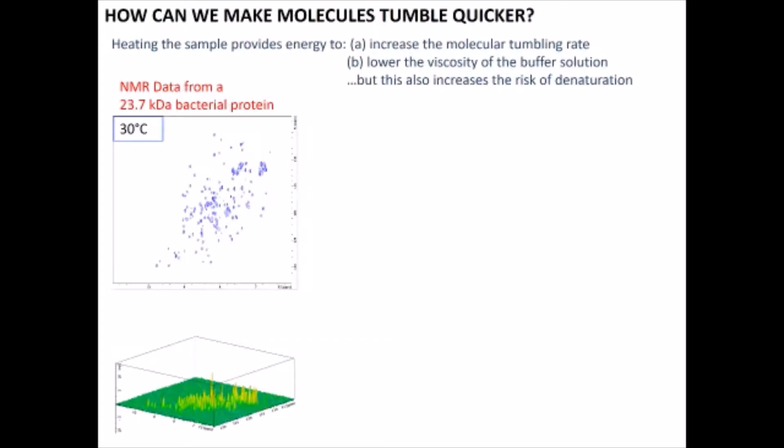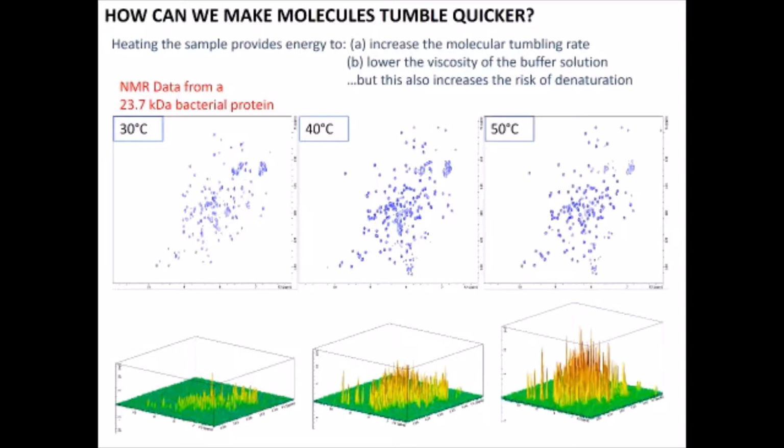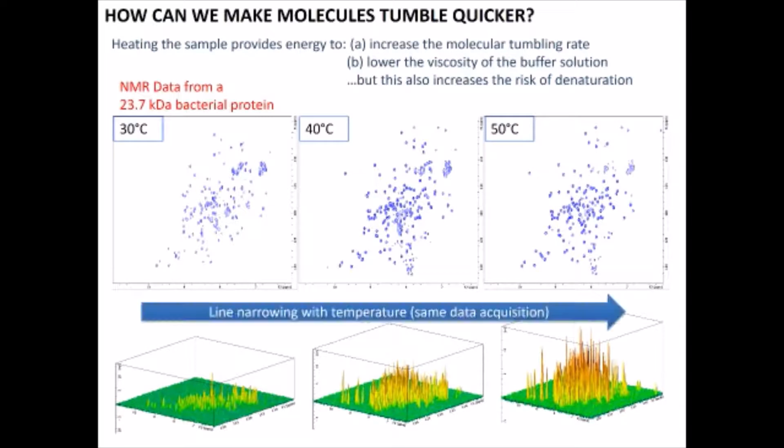So for example, this is NMR data from a bacterial protein at 30 degrees. At 40 degrees, you can see the peaks are getting narrower, and at 50 degrees. So yes, the peaks are getting narrower with increasing temperature, with the same time and scan parameters, but you start getting peaks which show evidence of hydrolysis in the spectra at higher temperatures.